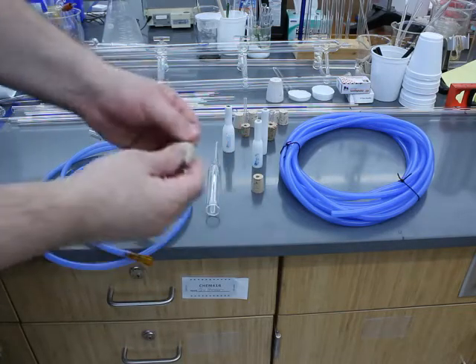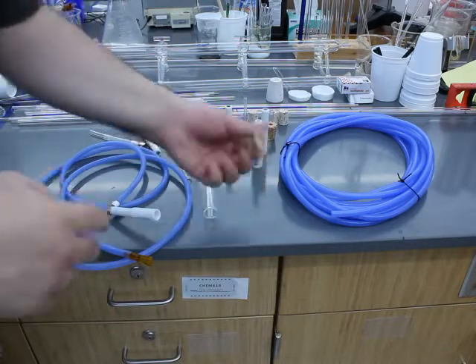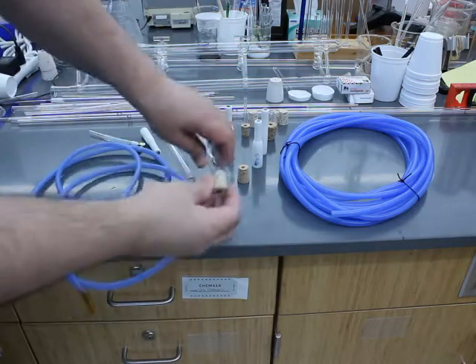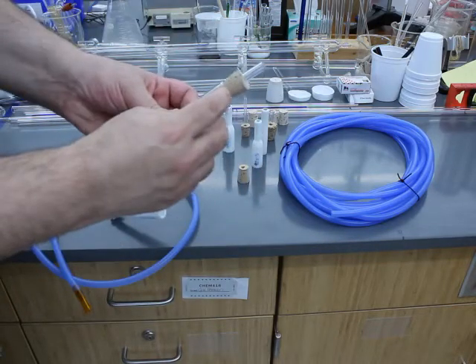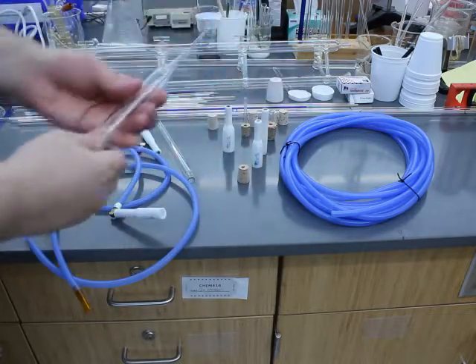You take a cork and you bore a hole through it and then you put a piece of glass or metal into it and then you'll seat it into the tubing you want. There will be hose attached here and then you go from there for blowing through it.